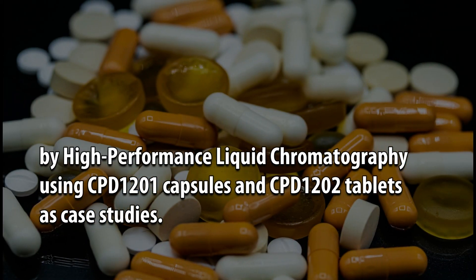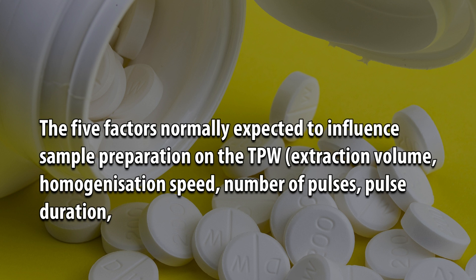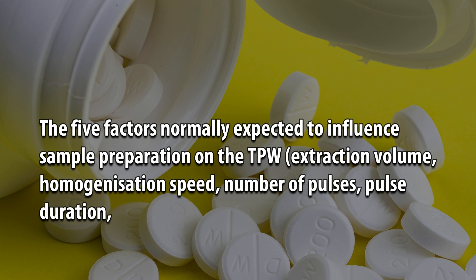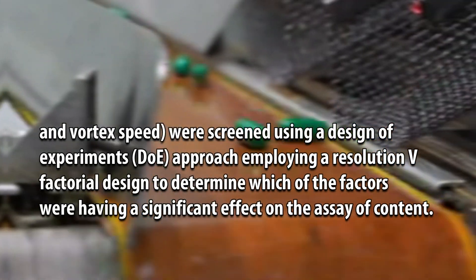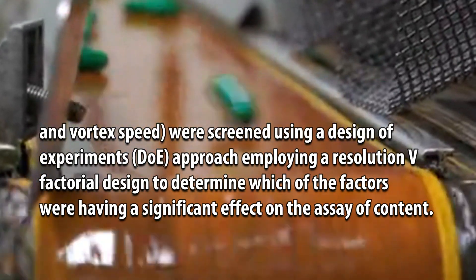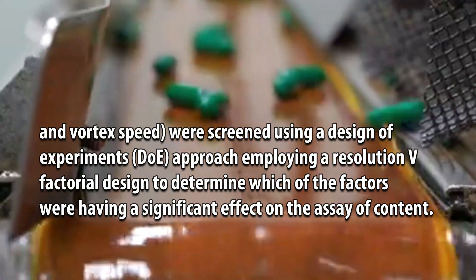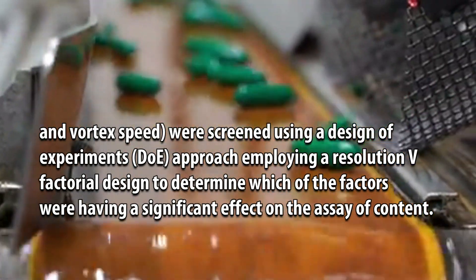Analysis was performed by high-performance liquid chromatography using CPD-1201 capsules and CPD-1202 tablets as case studies. The five factors normally expected to influence sample preparation on the TPW — extraction volume, homogenization speed, number of pulses, pulse duration, and vortex speed — were screened using a design of experiments (DOE) approach employing a resolution V factorial design to determine which factors had a significant effect on the assay of content.